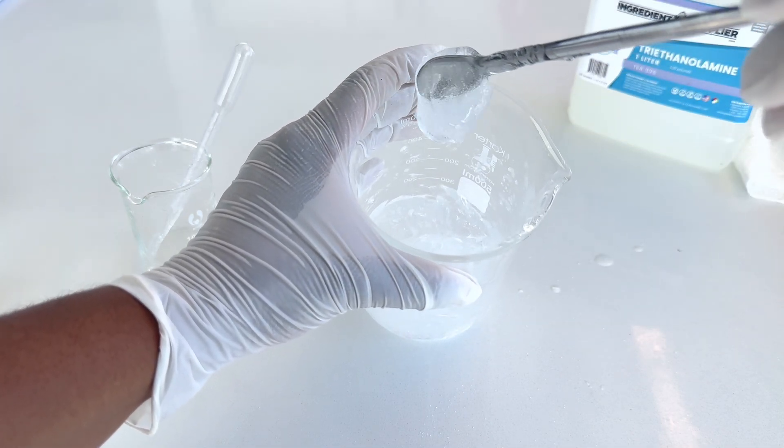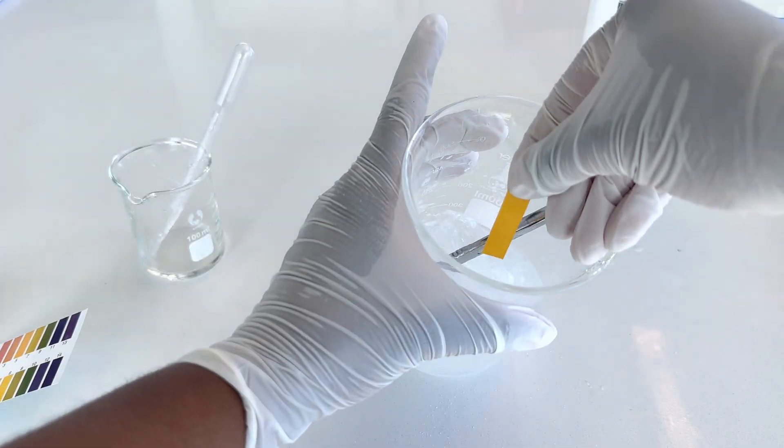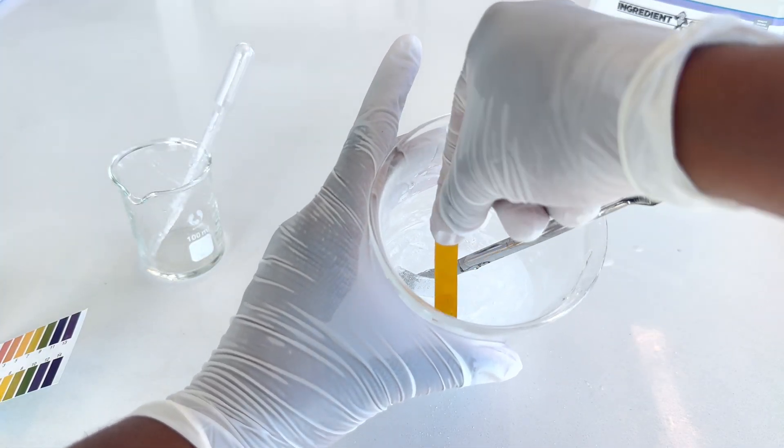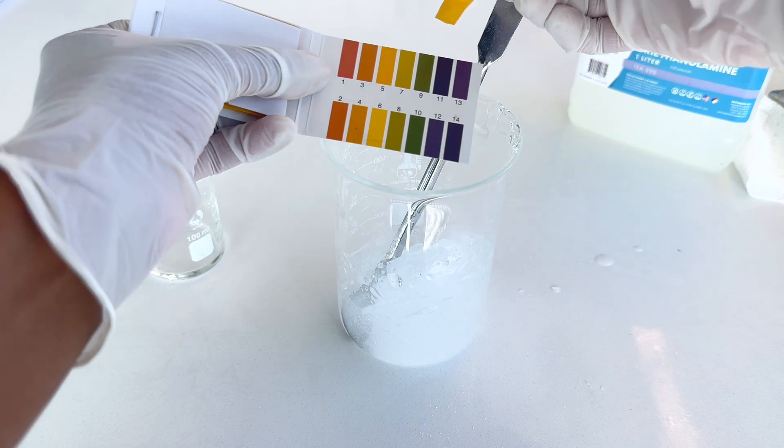Now we have a clear viscous gel. I took the pH again and now the pH is around 6.